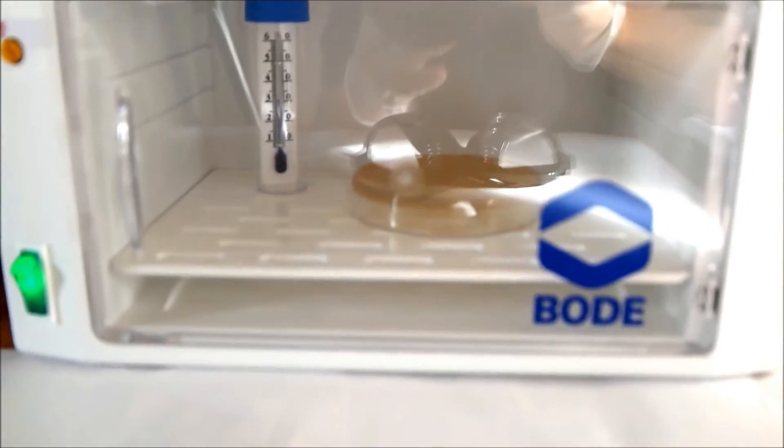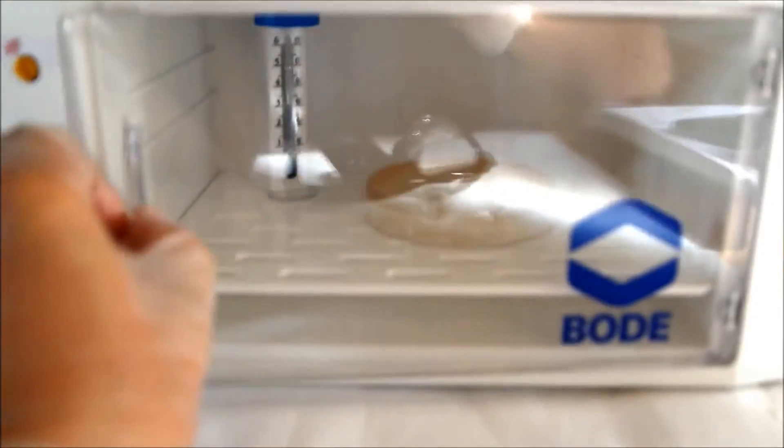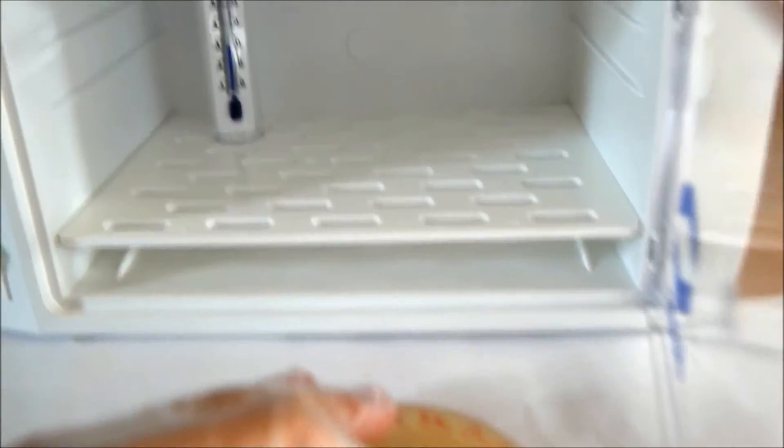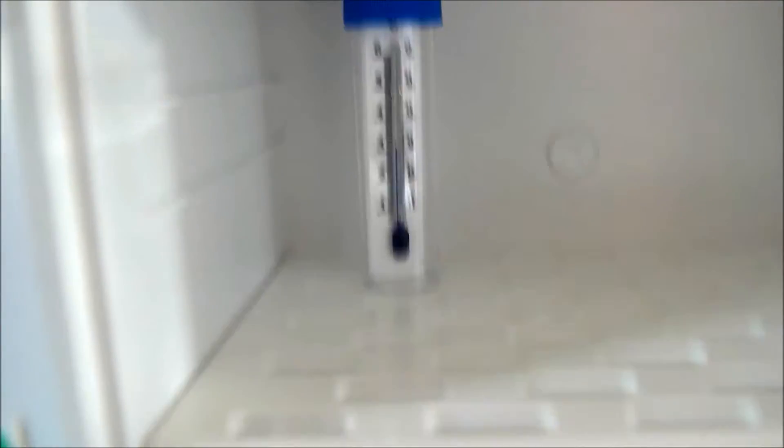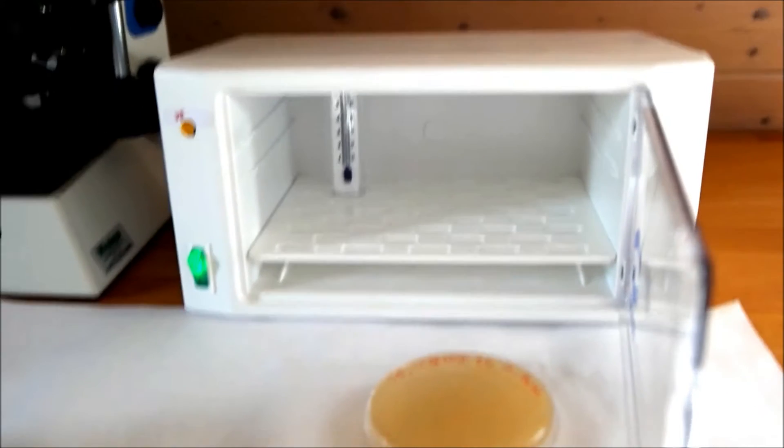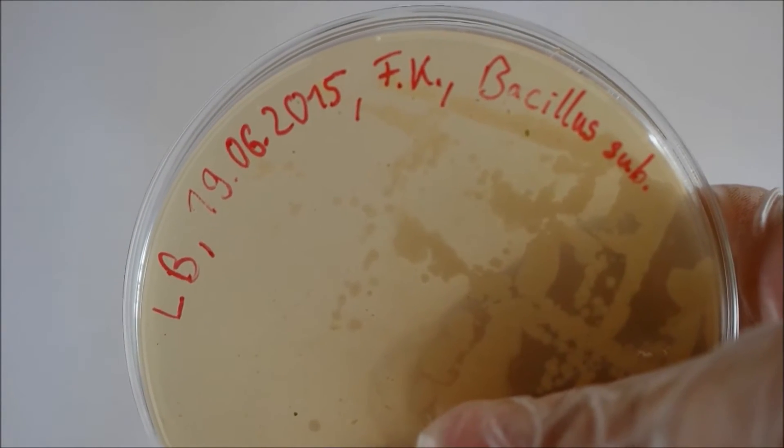Of course, you need a source of bacteria, and in my case, it's an agar plate in the incubator with some Bacillus subtilis cultures on it. So it has been in the incubator for two days at 30 degrees Celsius.